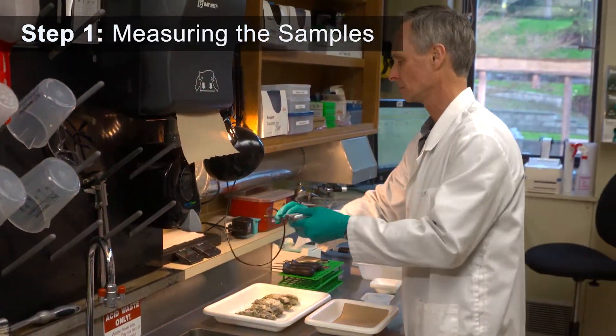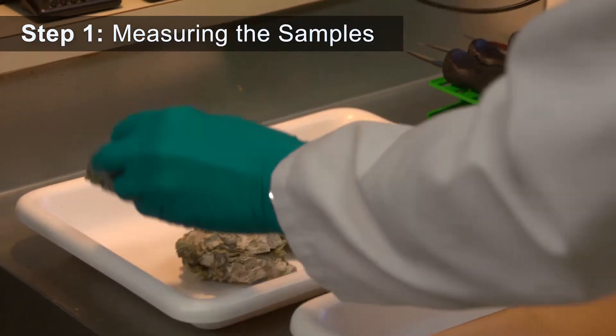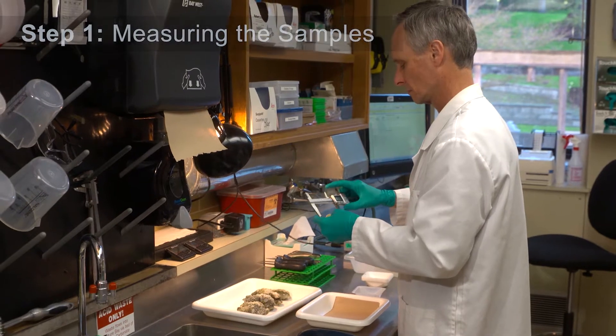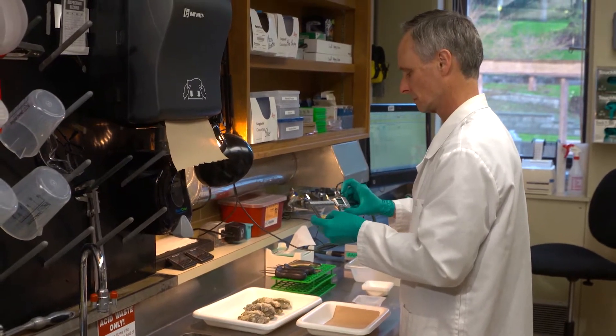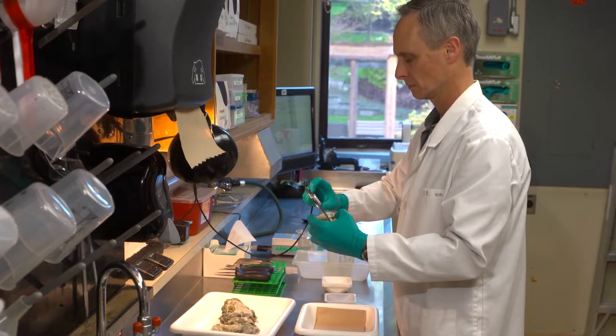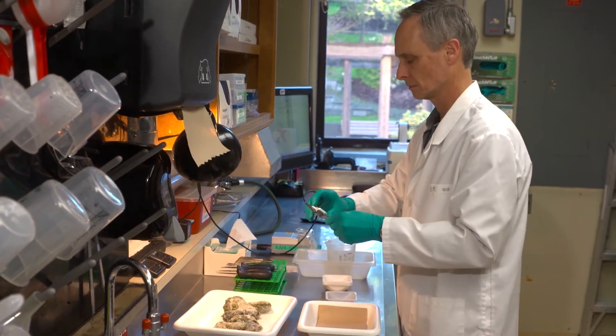Samples of a Pacific oyster are being taken in order to test them for diseases and parasites. First, electronic calipers are used to measure and record the shell length of the oyster sample.